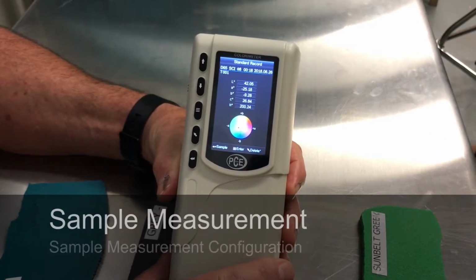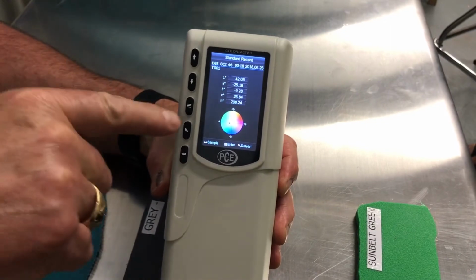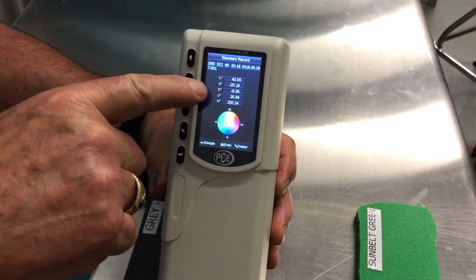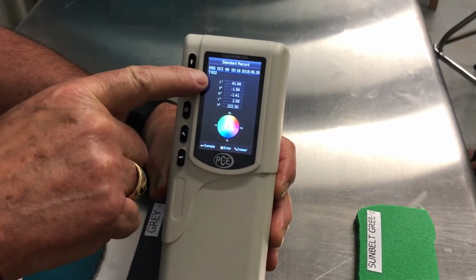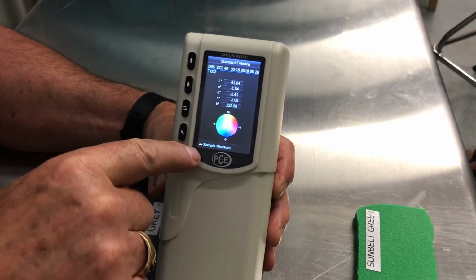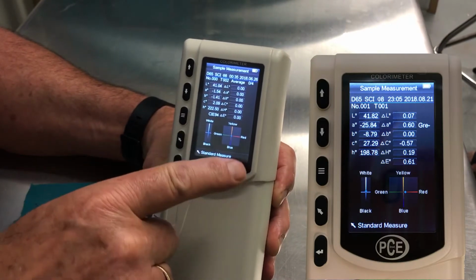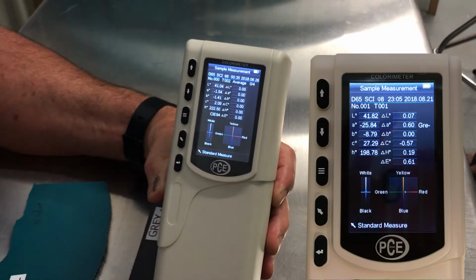Next, we have to change our standard color to number 2 to get our different color standard. So we just go T002 and enter, and then sample measurement. The screen splits. We're ready to take our sample measurement.